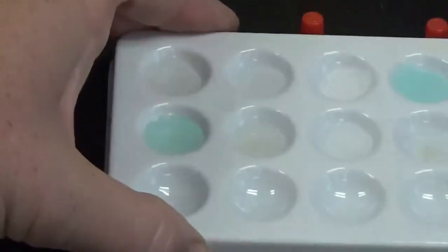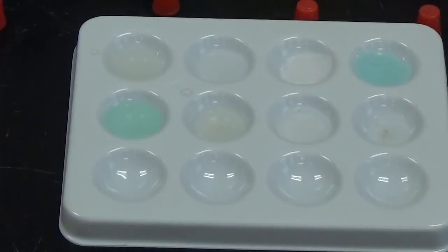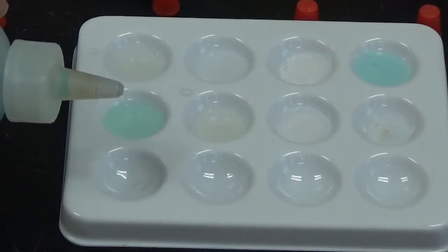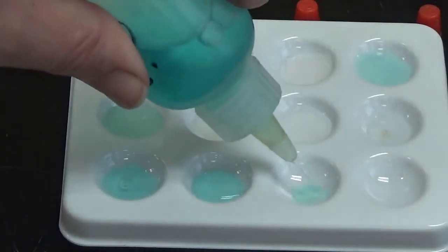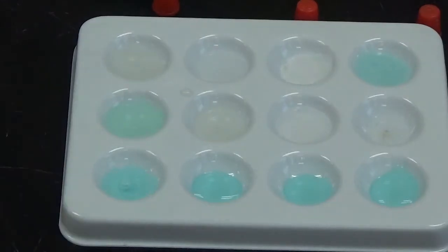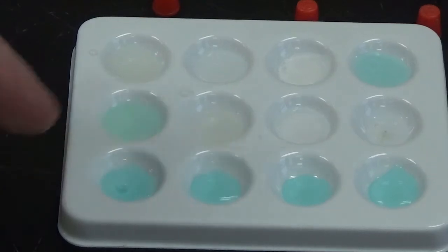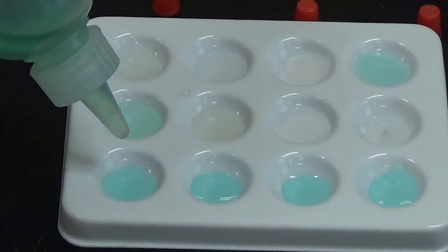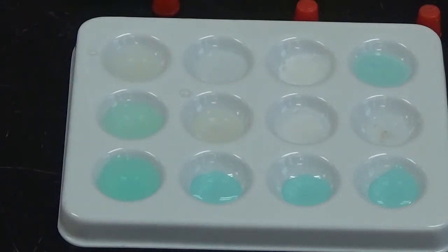Okay, so we're going to reuse a tray again. This time we are only paying attention to the bottom row. And the substance that we are going to start with is copper sulfate. So I'm going to put copper sulfate in 4 of them. Remember, it has that nice pretty blue color all by itself. Okay, so now to the copper sulfate, I'm going to add nickel chloride in this first well. And nothing going on there but a color dilution, because we added that green color to the blue, so it just made it a bluey green.